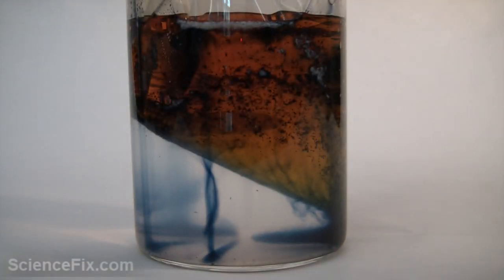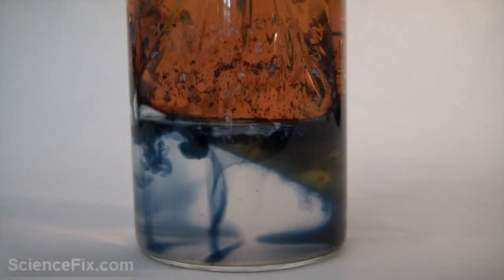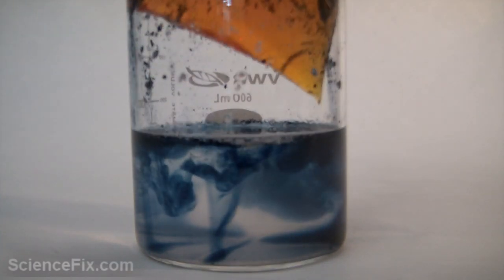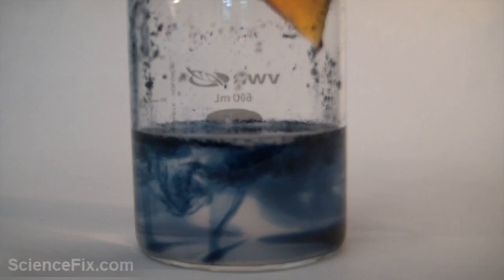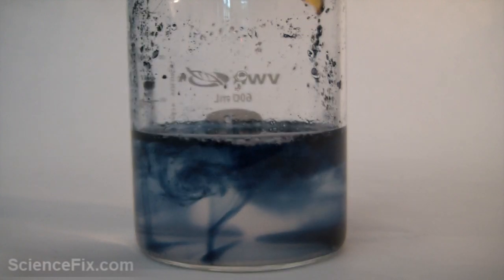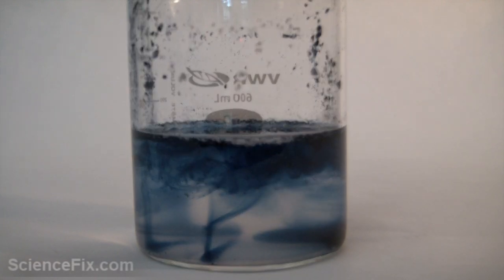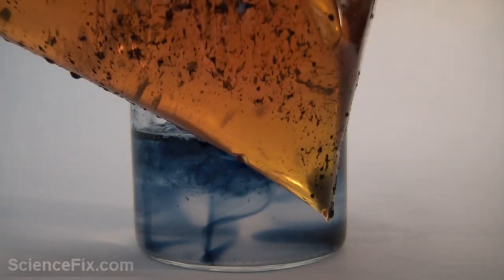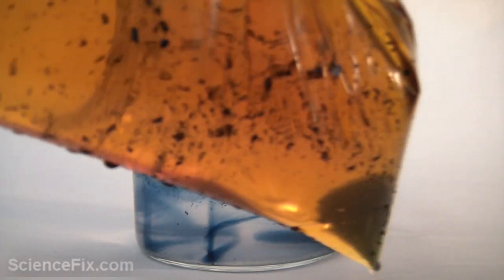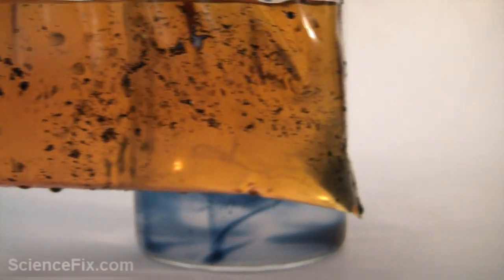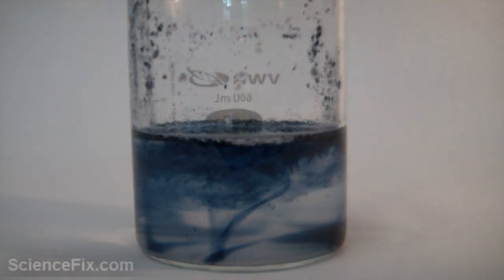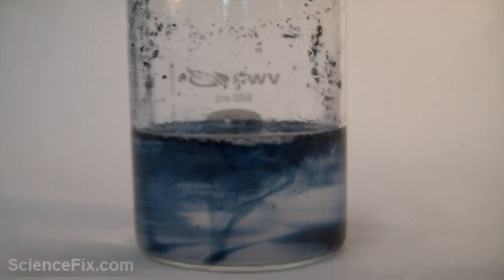through the plastic into an area of lower concentration in the starch water. You can see the bag is out now and the outside of the bag is purplish in color. The beaker is also now full of iodine because the starch has turned that bluish-purple color.